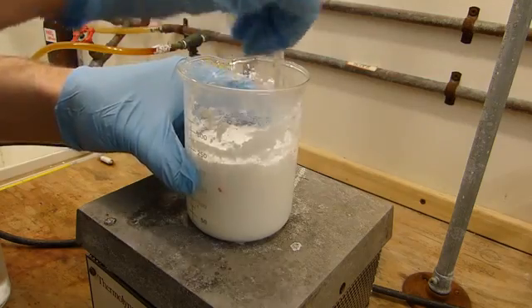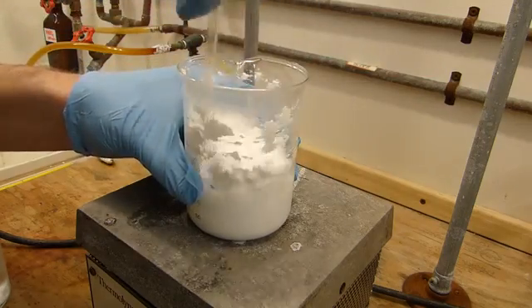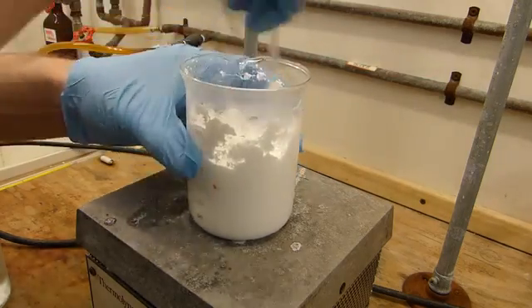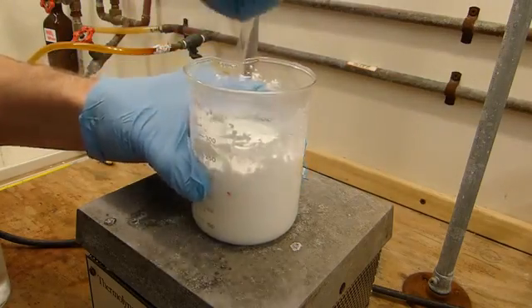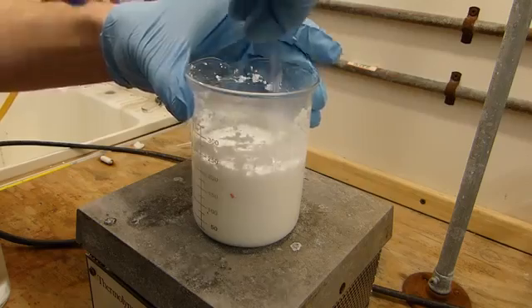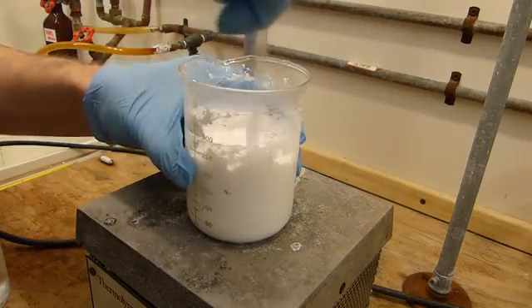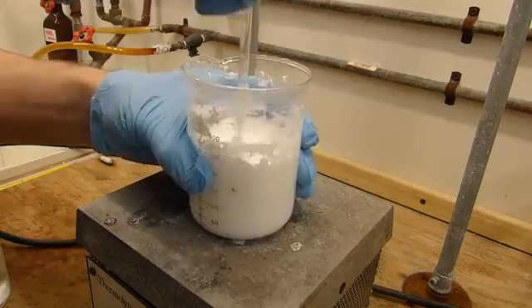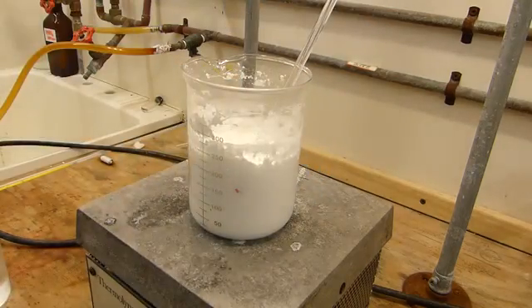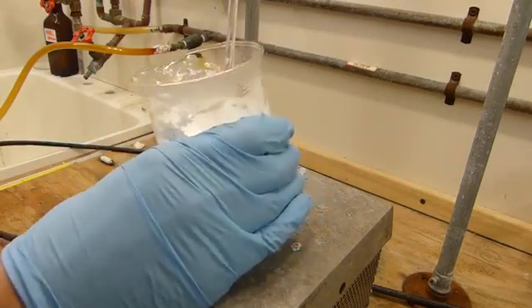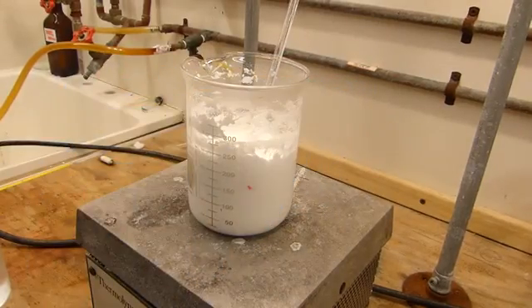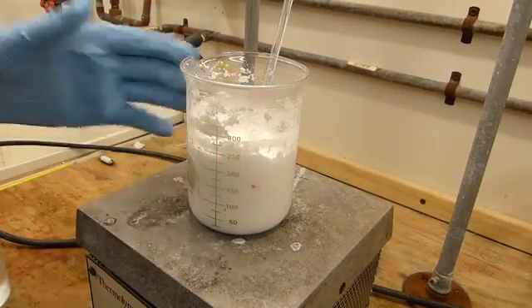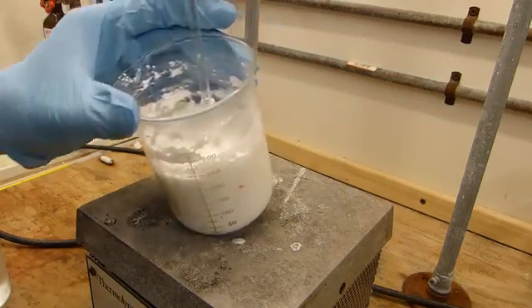And don't worry, just keep stirring it. It will eventually break the crystals enough that it will be liquid enough to pour. Continue to make that stir so you can see here. Okay, so this is a little warm. I'm going to let it cool out a little bit to just about room temperature and then I'll go ahead and vacuum filter this to recover the benzoic acid.